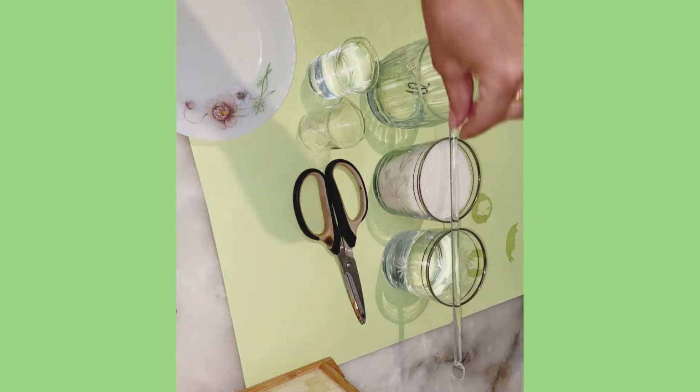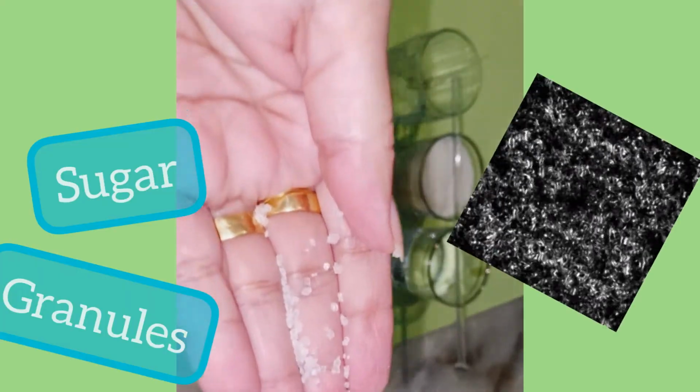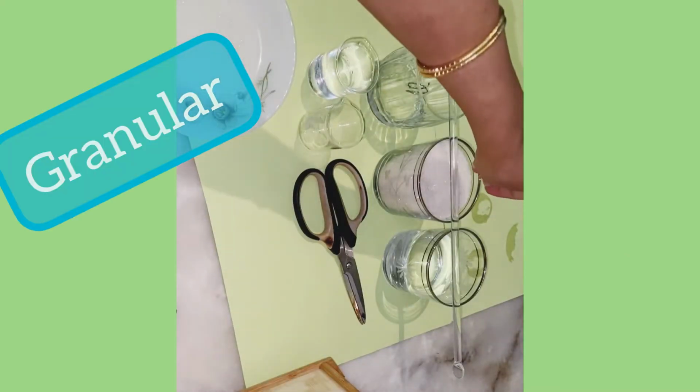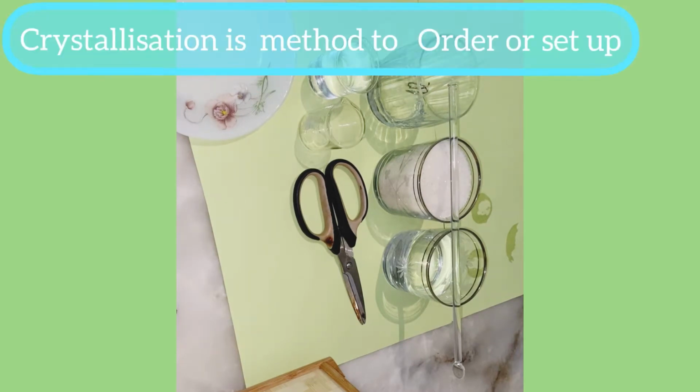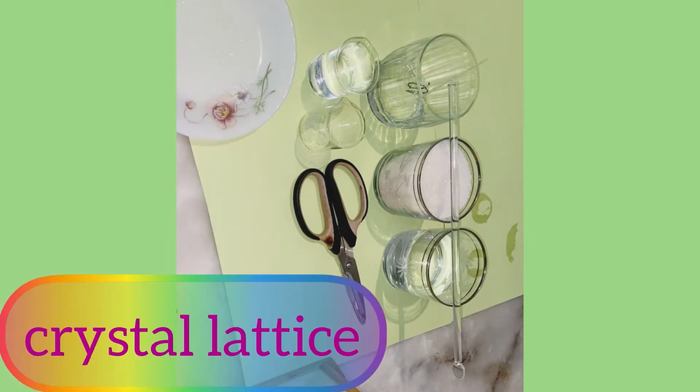How are you going to recrystallize sugar crystals? They are in granular form. So how are you going to crystallize them first, and then in the next step I will show you how to recrystallize that crystallized product. First, you should know what crystallization is, and how you produce a nucleus.